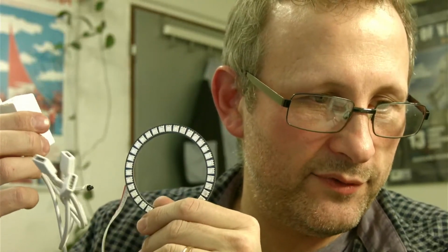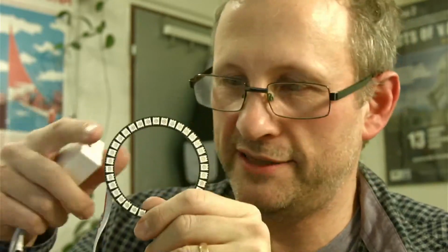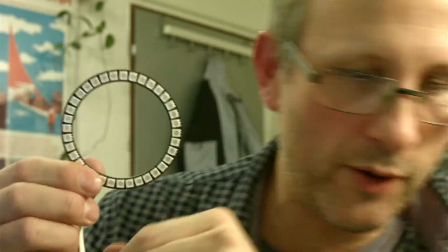So I was going to use this light, which is kind of like a vanity light for a car. You get four of them, and there's a little controller with an infrared type remote to switch the red, green and blue on here. I was going to use this to demonstrate to you today how this works. When I got it, it was fading between the various colors. I thought that was quite nice because you can see some of the LEDs go up and down, but I really wanted to be able to switch between the red and the green and the blue and mixtures of them, which I know this allows me to do.